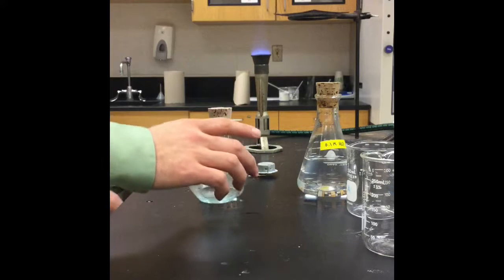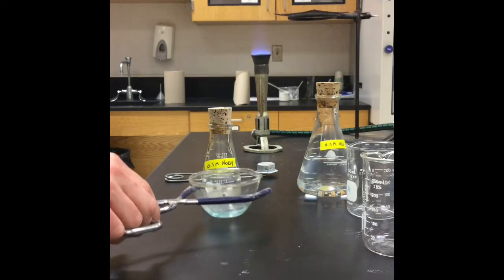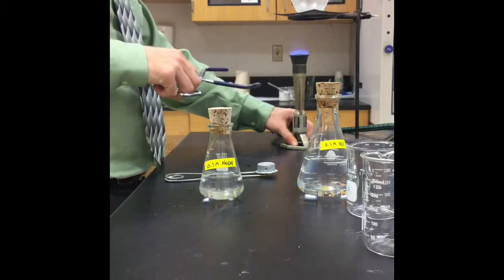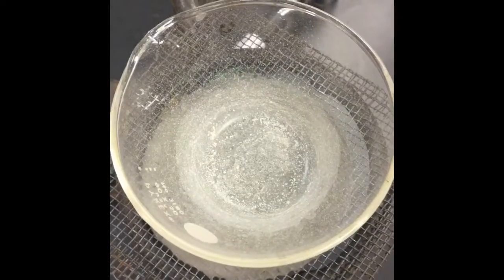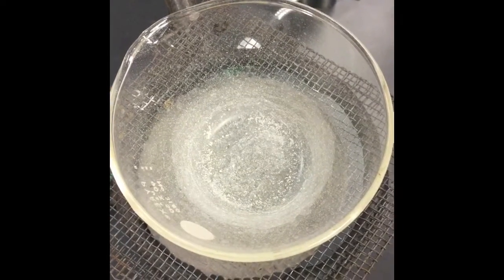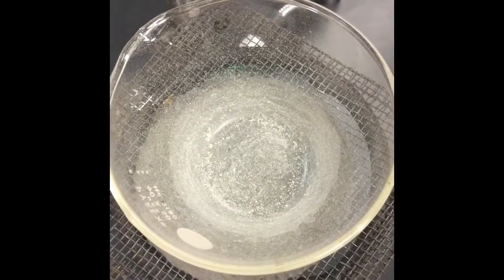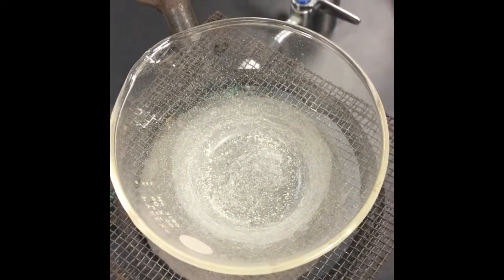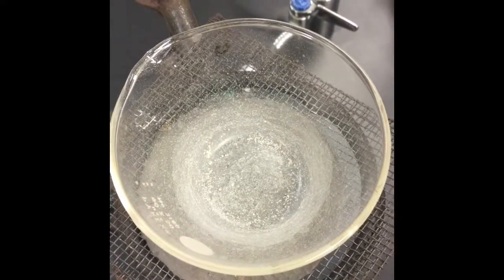So we're going to take this over to the burner, and we want to heat this until all of that excess water from the solution is driven off. So we'll put this over our burner. And we want to boil off all that water and see what happens. All right, so we boiled off all the water and we have this white residue left behind. So write all of your observations in your data table and write out a balanced chemical reaction for this reaction. Remember, HCl reacted with NaOH, so try to figure out what this white compound is.